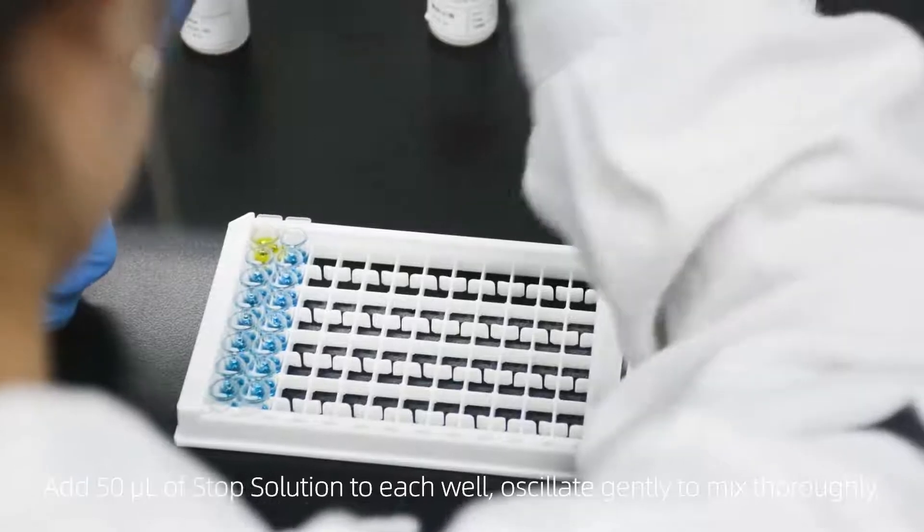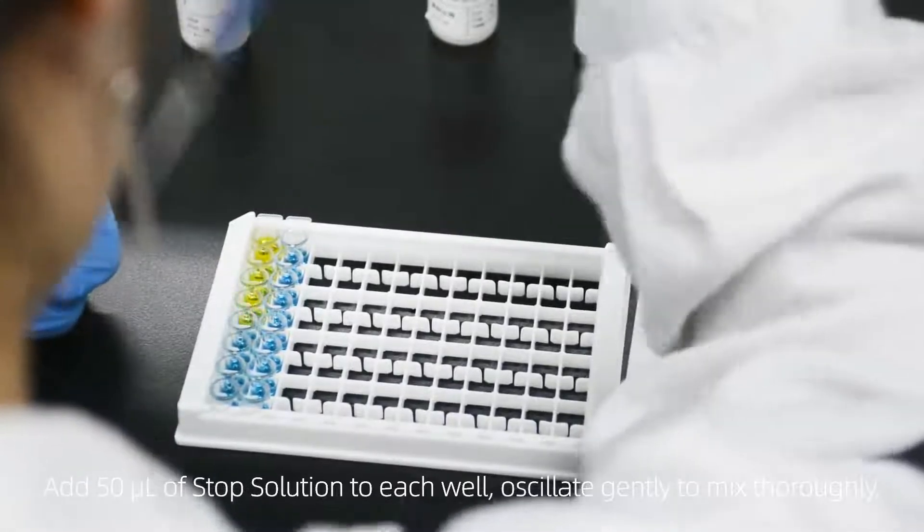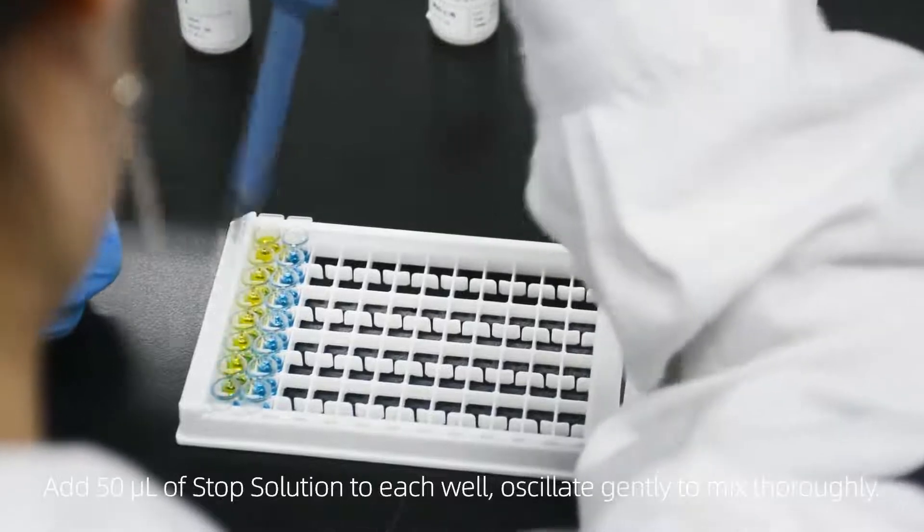Add 50 microliters of stop solution to each well and oscillate gently to mix thoroughly.